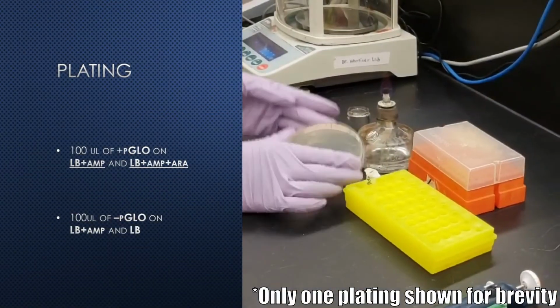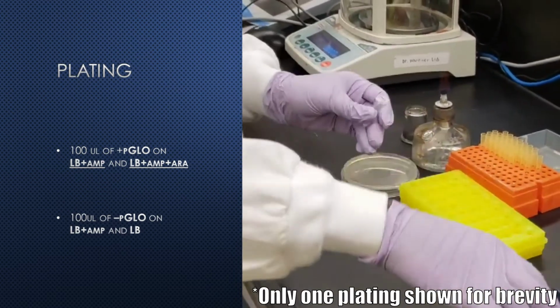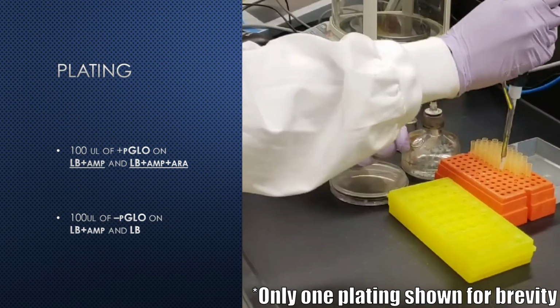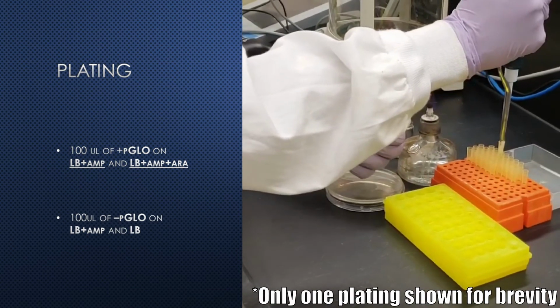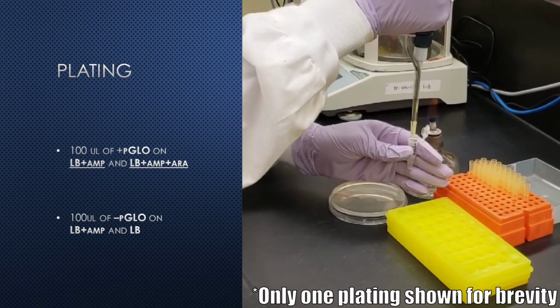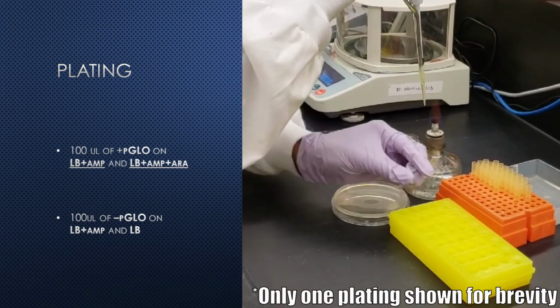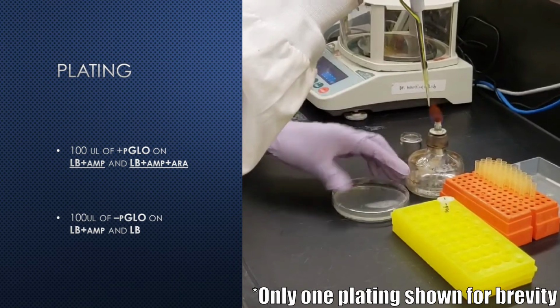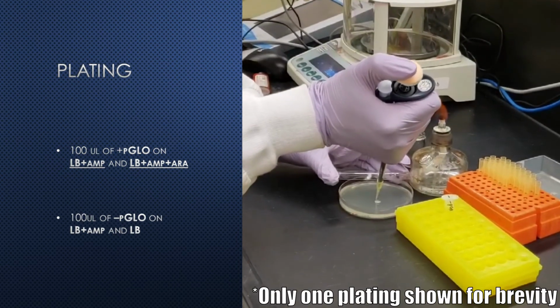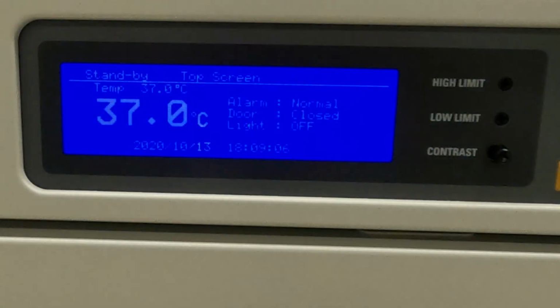Now, 100 microliters of the positive pGLO solution is plated on to LB plates containing ampicillin and then onto LB plates containing ampicillin and arabinose. Similarly, 100 microliters of the negative pGLO solution is plated onto plain LB and onto LB with ampicillin. Finally, the plates are incubated with the agar side facing up to avoid condensation at 37 degrees Celsius for 24 hours.